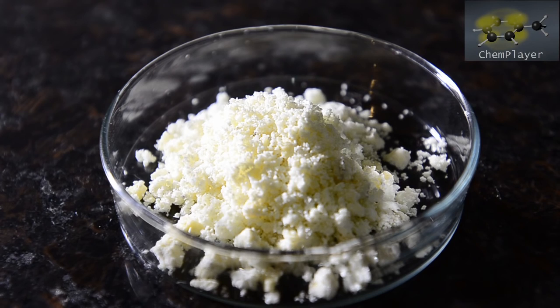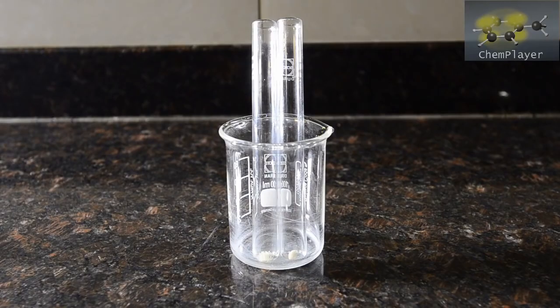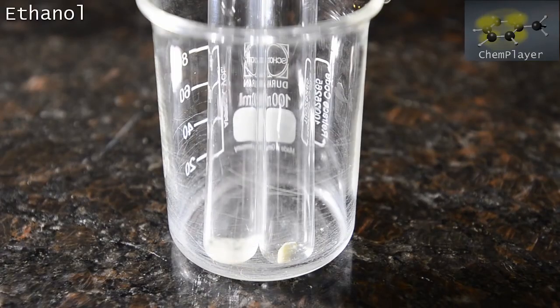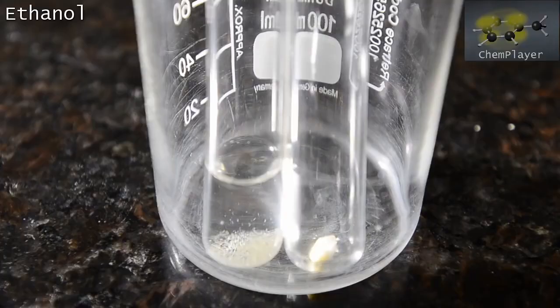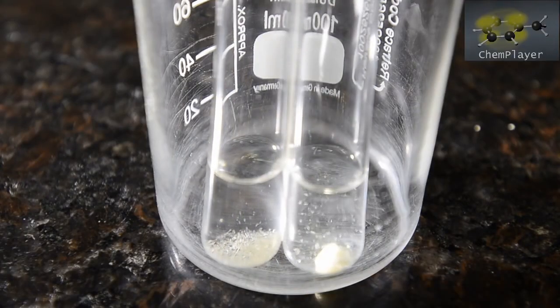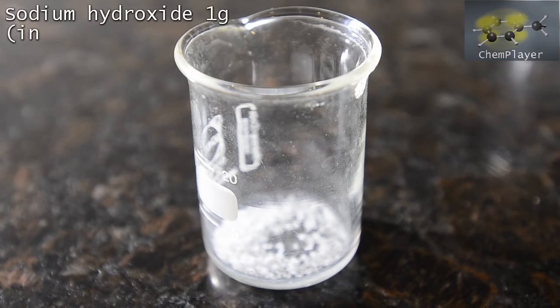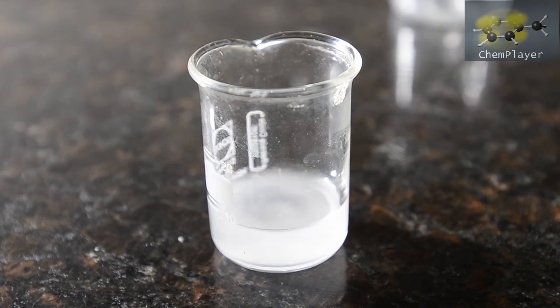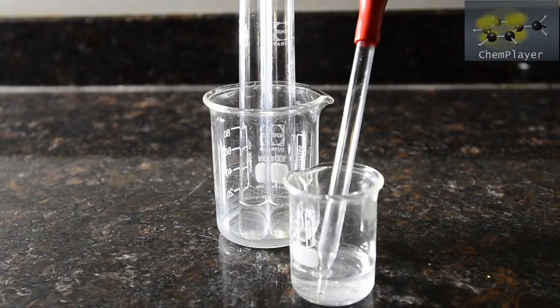We can check this by doing a quick test. In the test tube on the left we've got our starting material, benzoin, and on the right our product. First we add some ethanol to each tube in order to dissolve some of the material. Now we make up a little bit of dilute sodium hydroxide solution in water. Okay, now let's add a couple of drops of this to each test tube.